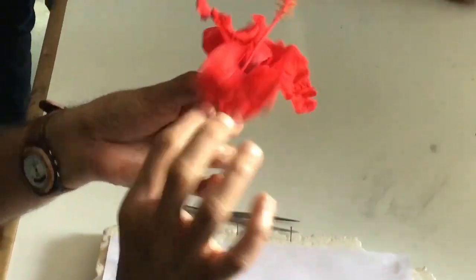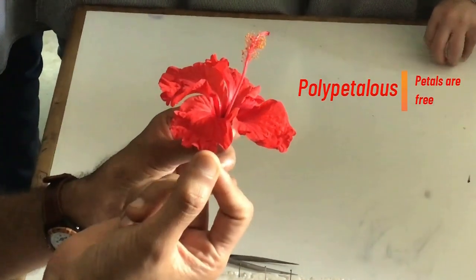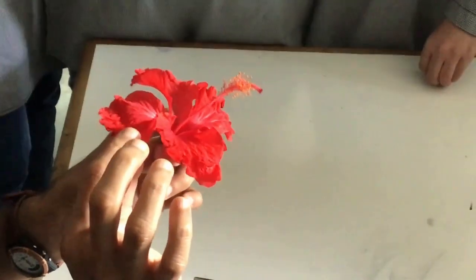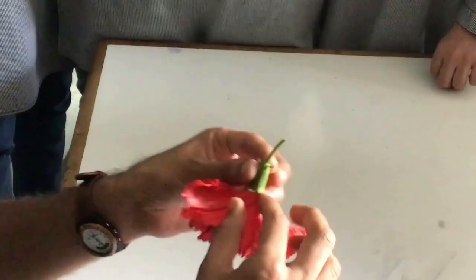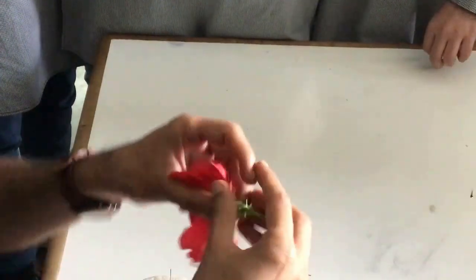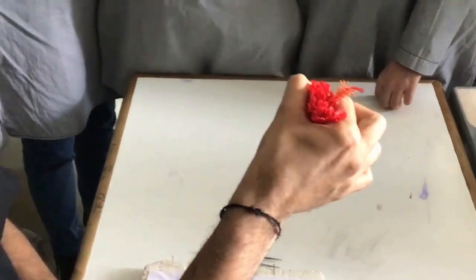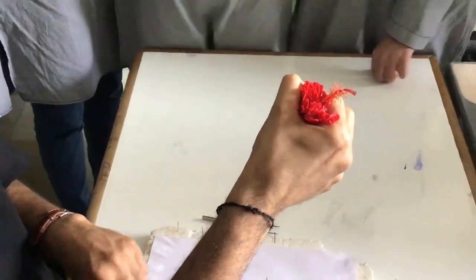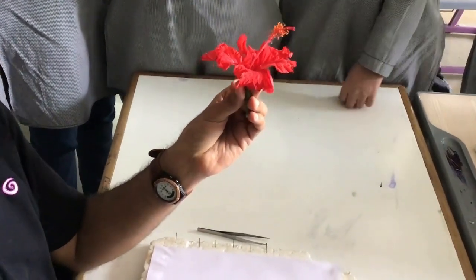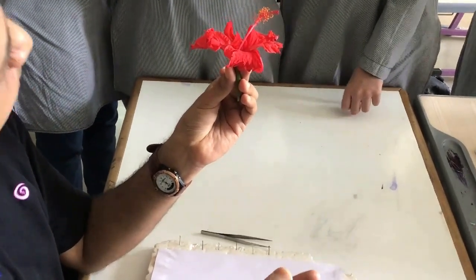Petals are free — they are not fused together. When something is free, we use the word poly. So the corolla is polypetalous — petals are free. If sepals were free it would be polysepalous. If petals were fused it would be gamopetalous. So this flower is gamosepalous and polypetalous.